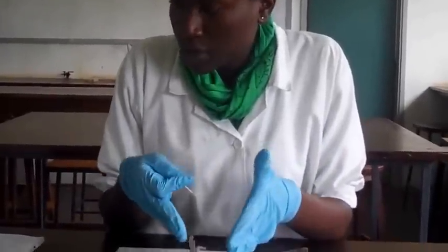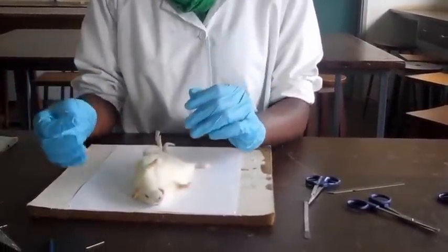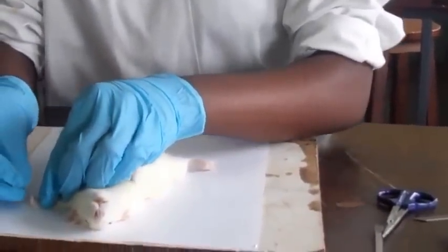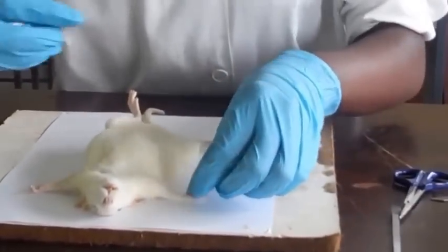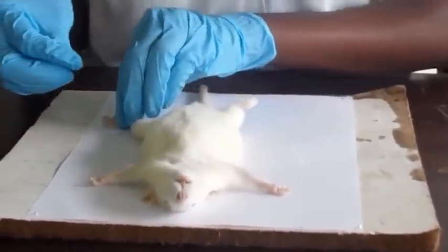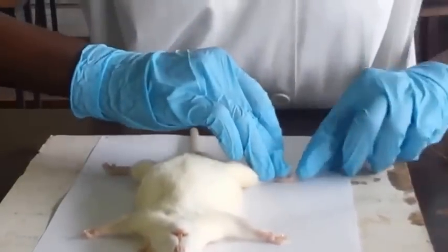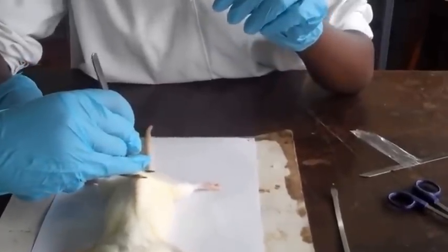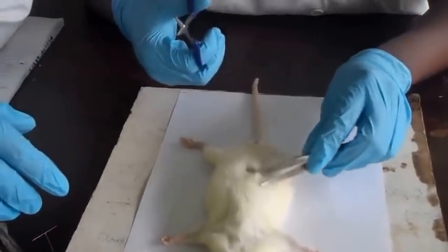So we're going to look at the superficial features or structures of the rat, those that lie right under the skin. So that involves dissection, because we'll have to first remove the skin and see what we want to see. So we shall first pin it to the board firmly with the ventral side uppermost. With 4 pins, pin each limb. First, cut off a small part to create a slit where you're going to hold and cut inside.